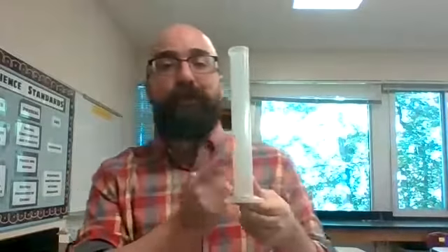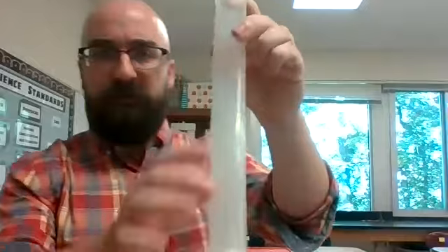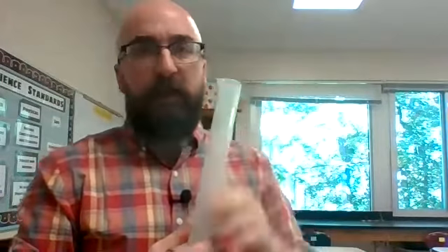This is a graduated cylinder. This is a really careful way to measure the volume of a liquid. It's a lot more careful than my big old clunky measuring cup. If you look closely at a graduated cylinder, it marks off very small volumes, so you can measure really, really closely. Here's a close-up view of the graduated cylinder.